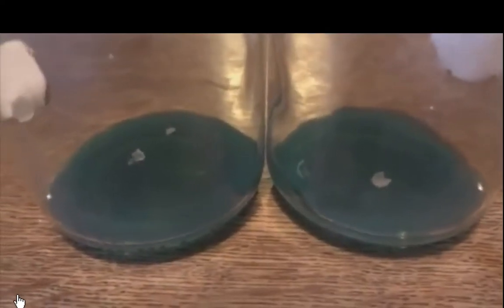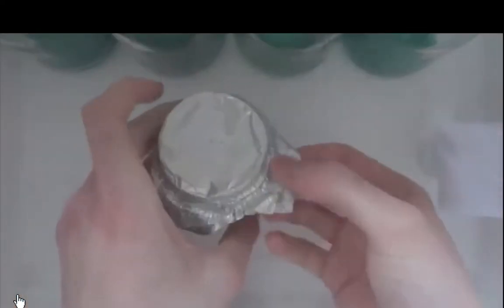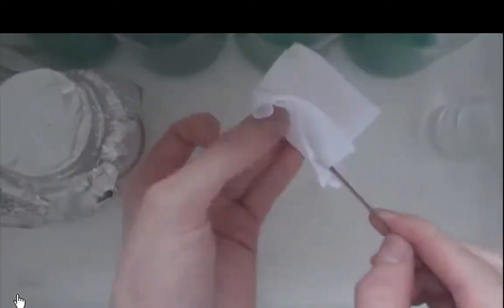I find 20 degrees is good. It isn't the fastest, but it seems to work. As you can see there, I experimented with very small pieces of tissue, but as I had lots of the plates laying around, as you know, I made 4 of them.